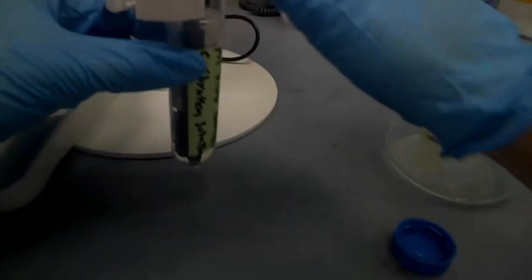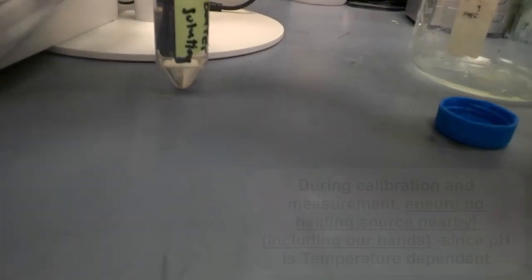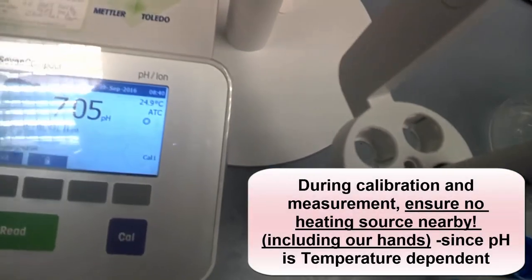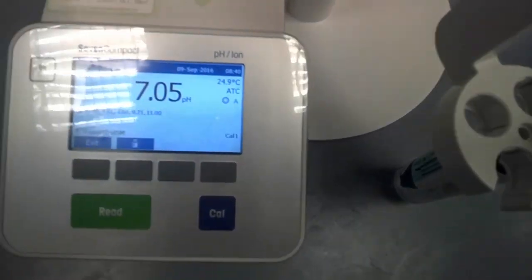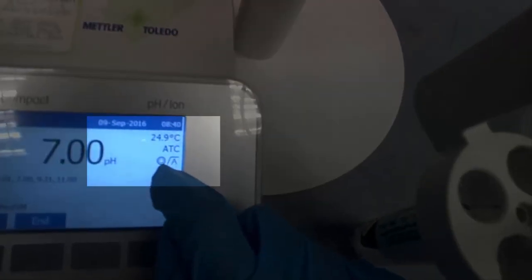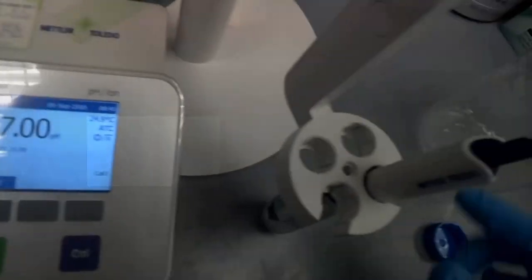The best thing you do is actually to place the buffer inside here and I do not hold it because my hands are warm. So we know that pH is affected by temperature change. You see that there's an indication of temperature. So take note of this temperature when you measure your pH and also during calibration. Now you hear the sound. There's this signal here, the line, and it's not flashing, not blinking. That means it's done for this pH.